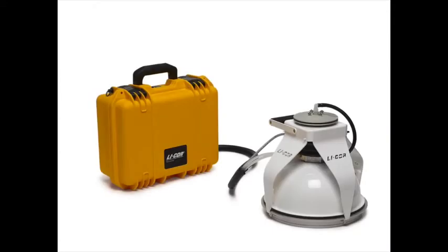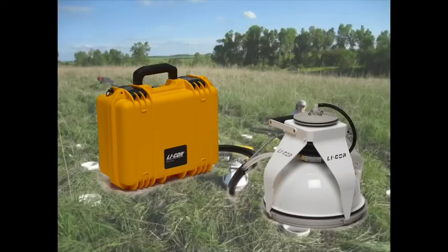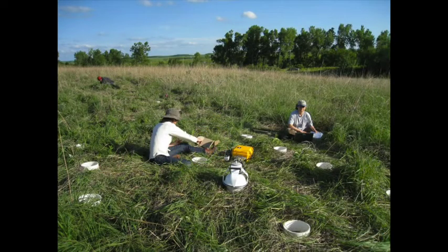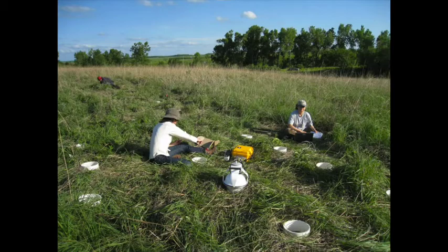Today, we will learn how a closed dynamic measurement system works, and we will go to a long-term ecological research site in Kansas known as the Konza LTER to measure soil CO2 efflux as part of an ongoing research project.